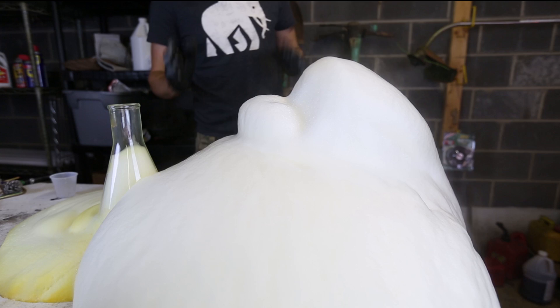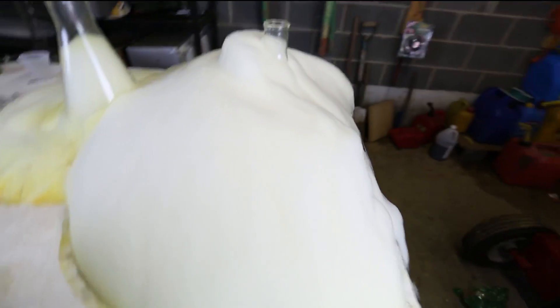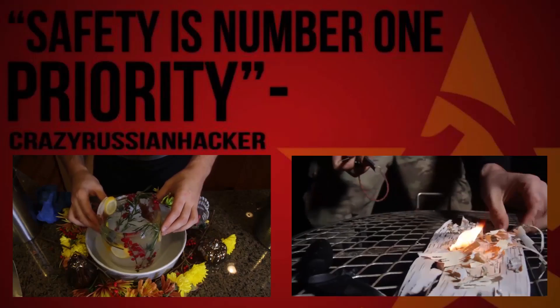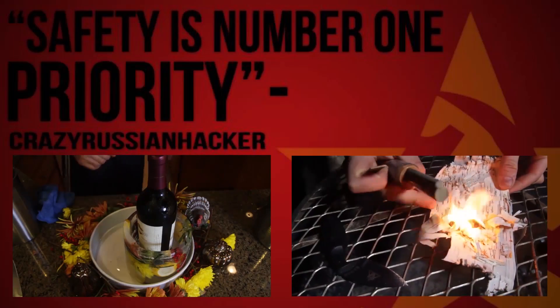What do you guys think? I just needed a little bit more potassium iodide. This is insane. Look how much foam! Thumbs up for this experiment for sure — results came out that well. Look at this, look how easy it is.